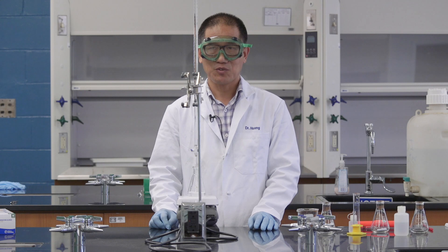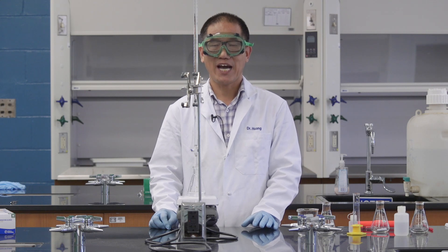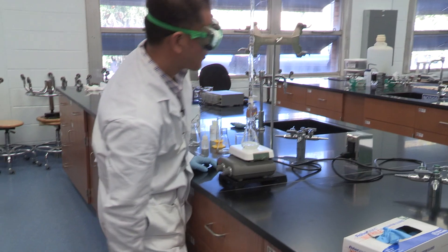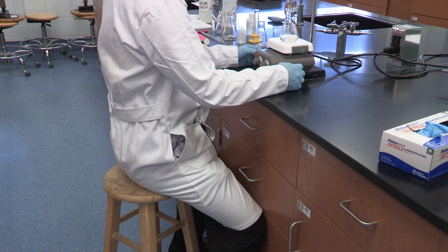Next, we are ready to do the titration. When you do titration, you want to make sure you are comfortable. So I need a chair behind me. Now I'm very comfortable.